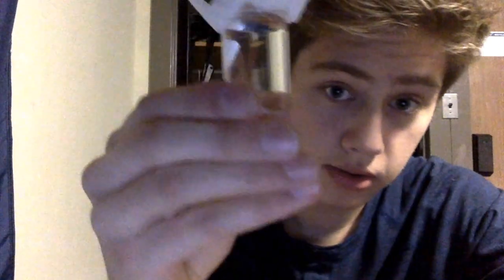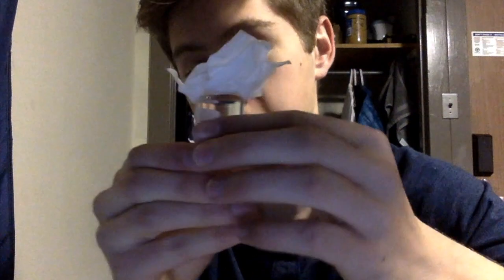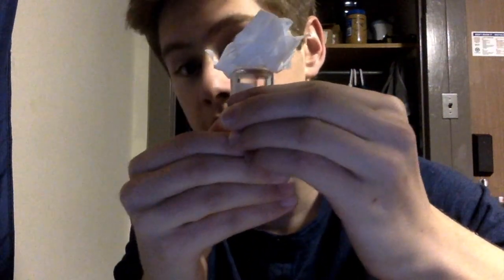So this is my solution. As you can see, there's virtually no crystals to speak of. I can't even see the beginnings of crystals. While that may sound bad, I think it's probably okay because the timestamp on this is 4:40 on Tuesday. It's currently Thursday at 7:20. So I don't think I would expect any crystals to have formed yet. I think this should be a more long-term reaction.